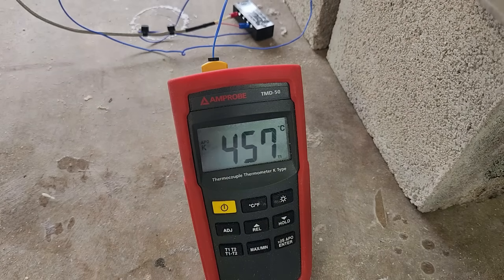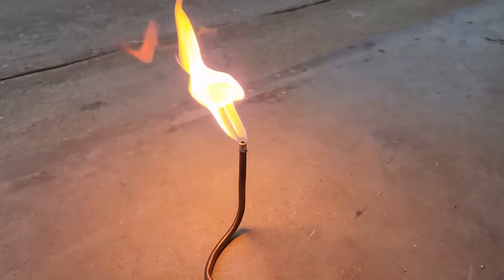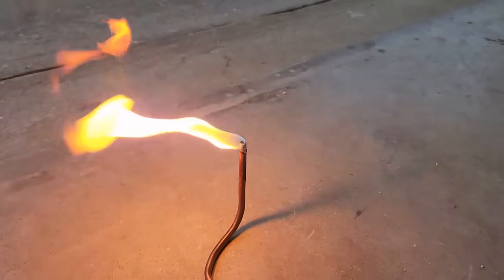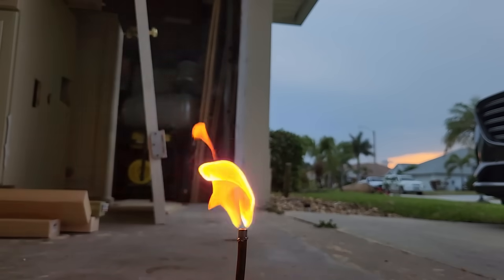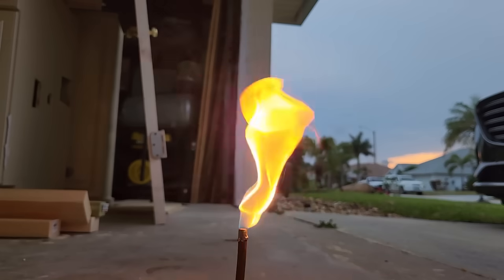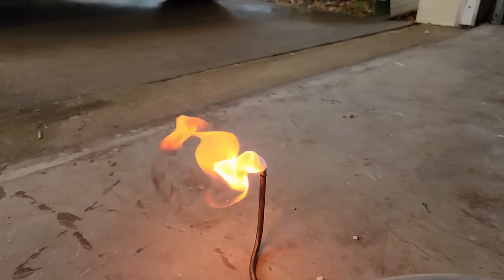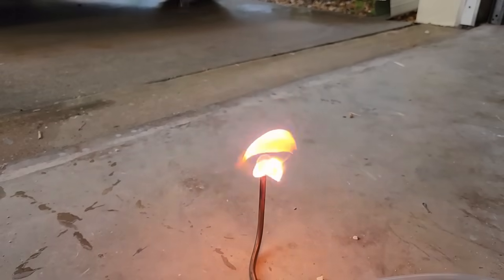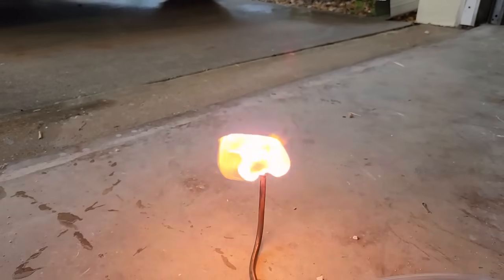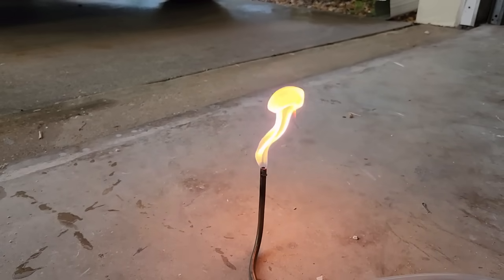Once the catalyst is up to temperature, I light off the output. The flame burns bright yellow and gives off a lot of smoke and soot. This is a very obvious indicator that what we're burning is in fact ethylene and not diethyl ether or unreacted ethanol vapors — if we ignited either of those, they'd burn a very light blue, nearly invisible flame. The soot is apparently from the carbon double bond in the ethylene. You see a similar effect from acetylene fire, which is a carbon triple bond. Methane, propane, methanol, ethanol, and so forth don't have these multi-bonds from carbon to carbon, which is part of the reason they burn with a much clearer flame. Another indicator is the smell — I pick up a sweet but musky, pungent aroma coming off the output pipe, which is how the smell of ethylene is typically described.